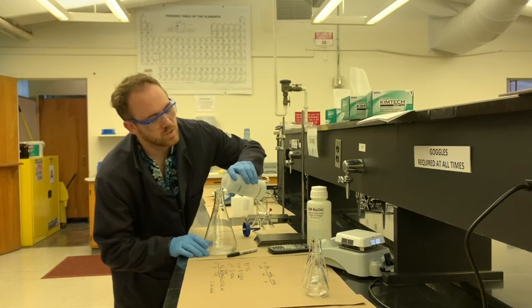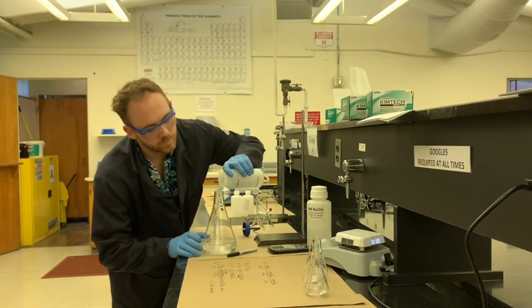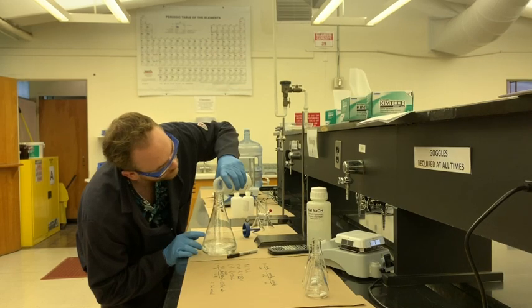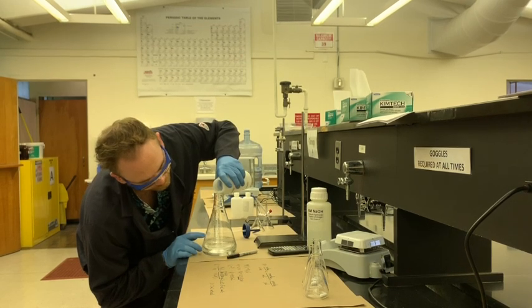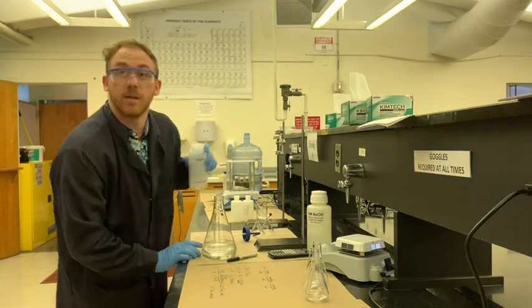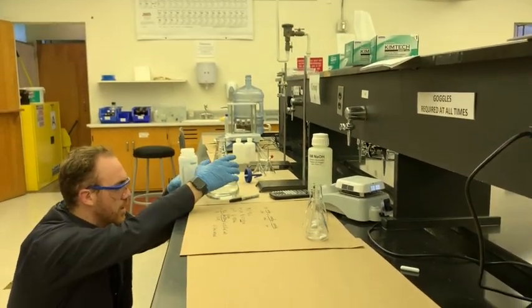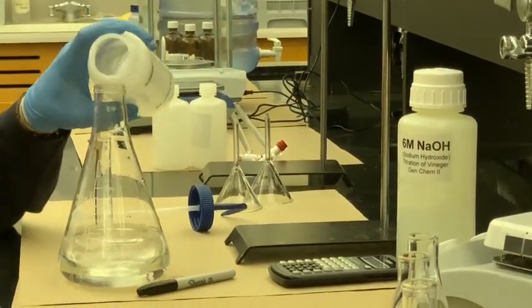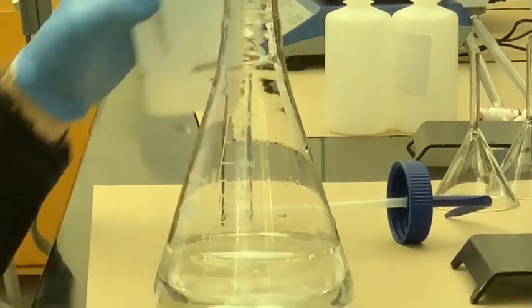quickly. Squirting out 500 milliliters through that nozzle would be pretty tedious. Don't want to go past the line though. This wash bottle alone contains about 500 milliliters. This flask is anything but ideal for this kind of measurement too, because the graduation for 500 milliliters, seeing the meniscus for that is going to be pretty tough. And also waiting for it to steady is kind of a nightmare. Just a little bit more. A little bit more. And it's good enough.